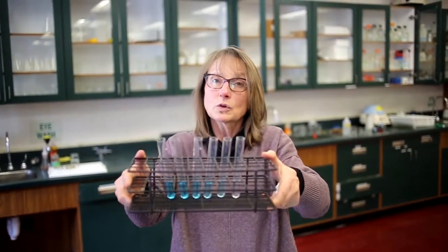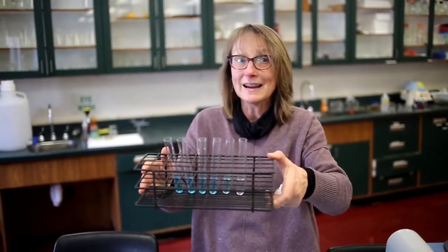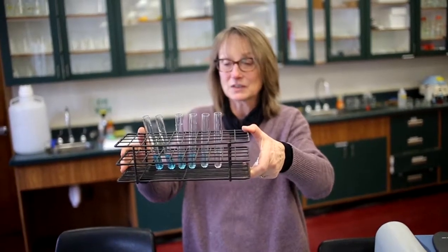So what we're going to create is what we call a standard curve. Now, if we were really good at pipetting, really accurate and precise and consistent and weren't sloppy, we should create a chart that we can use to determine the concentration of an unknown. So we'll see how good Melanie and Janet were at creating these tubes that are going to serve for us to make a standard curve.